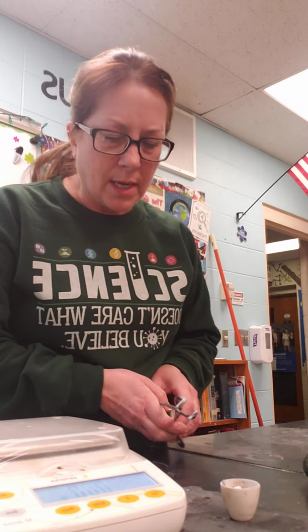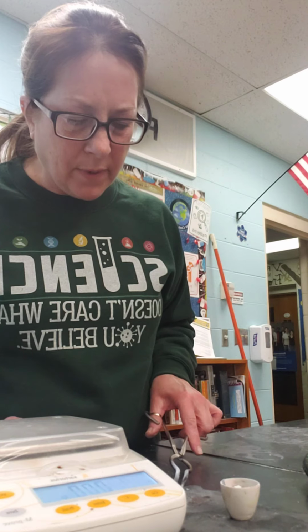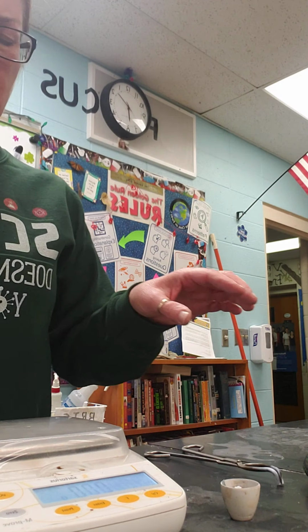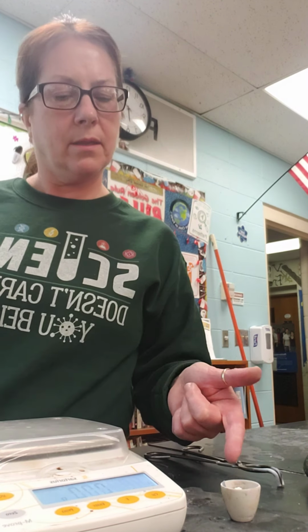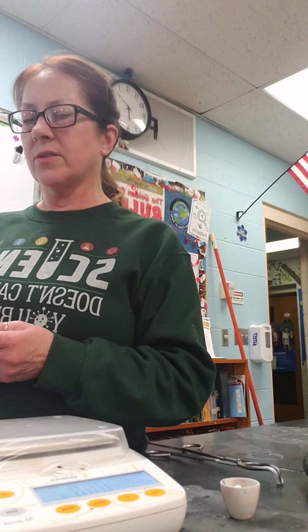We don't need this anymore. And let me get these pieces of magnesium back in there. Okay. All right. Now I'm going to go on to the next part. So as soon as I put the crucible back on here, you can record the final mass and then go through and answer the questions.